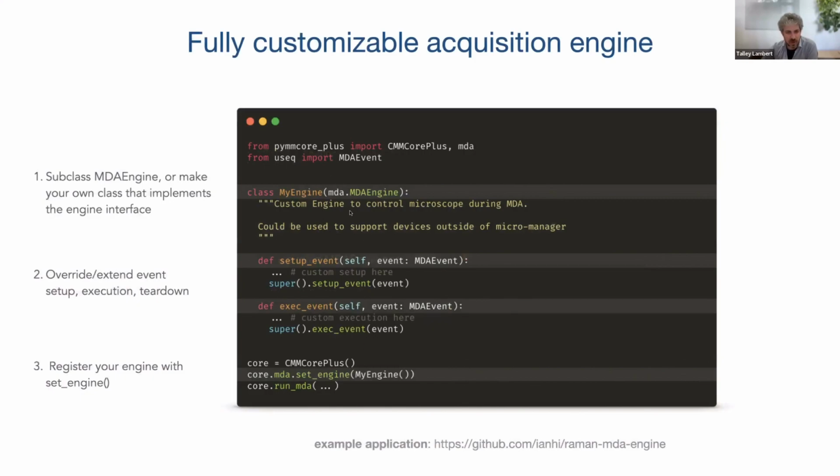This is some code that shows you how to do that. So again, we're going to import PyMM Core Plus itself, and down here I've made a core instance. And what I'm going to do is set the engine to a custom object. So what is this? This object here is a subclass of our MDA engine. So MDA engine is the thing essentially that executes the sequence of events.